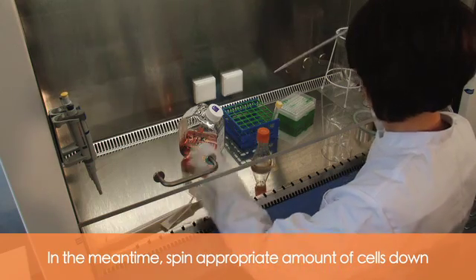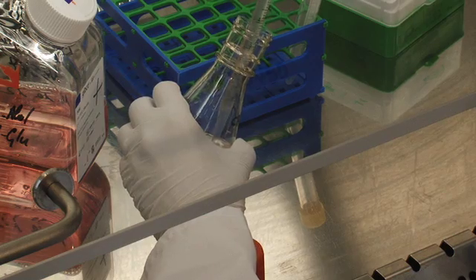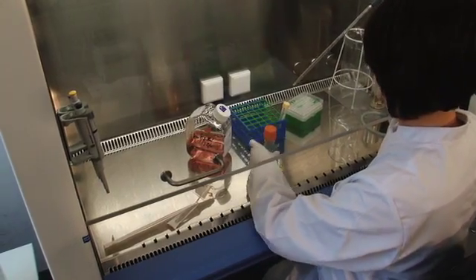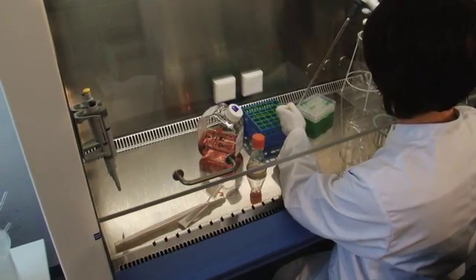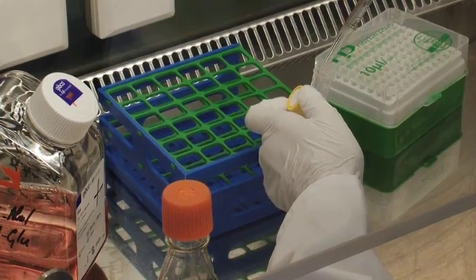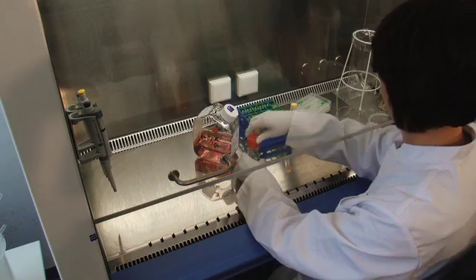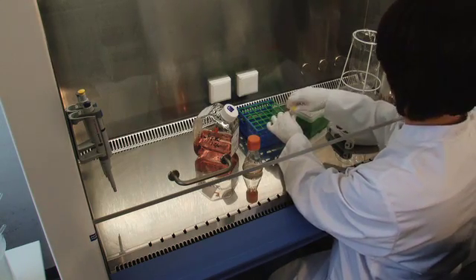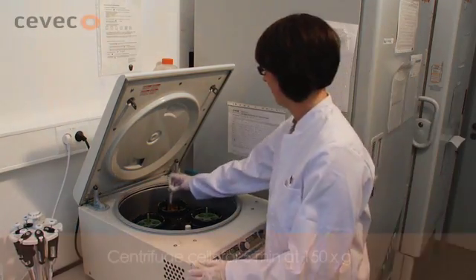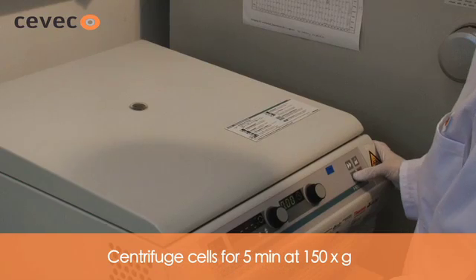In the meantime, spin an appropriate amount of cells down as described in the written protocol. Centrifuge cells for 5 minutes at 150 g.